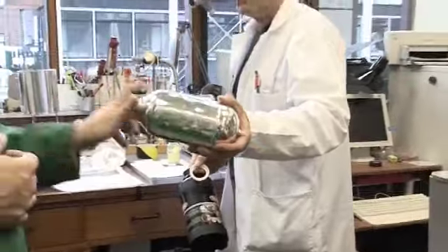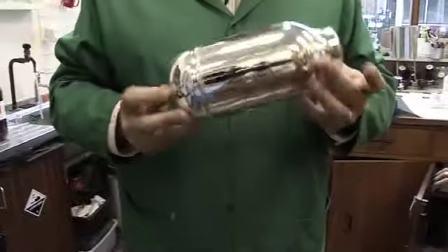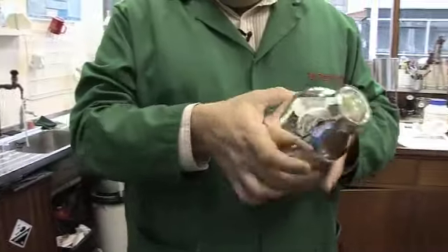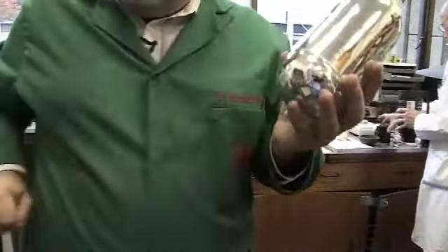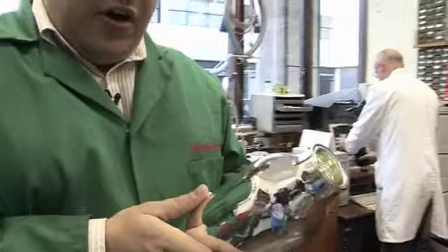So Neil is taking one apart. What we can see here is the inside of a thermos flask. This is just a glass envelope which we connect to a pump and we suck out all the atmosphere to make a vacuum inside.